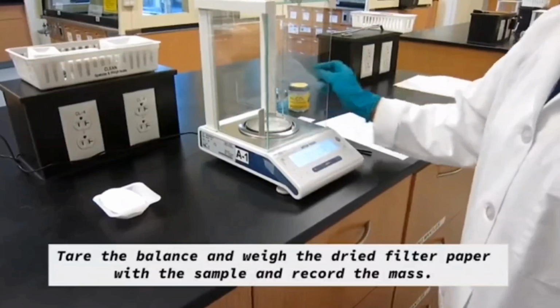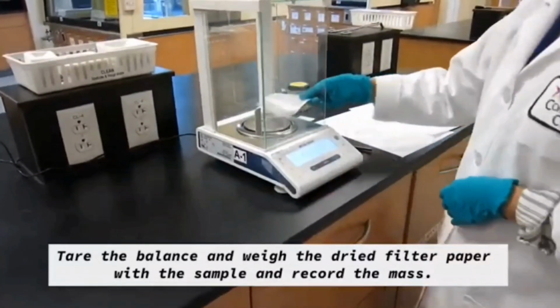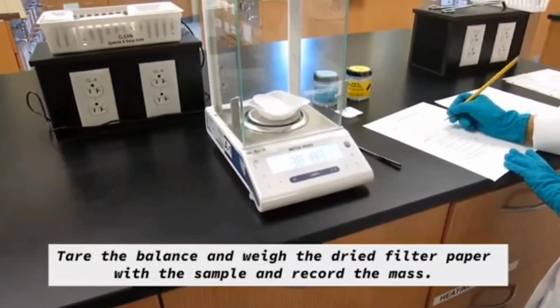Now our calcium carbonate precipitate is ready. You're going to take it to the balance, zero the balance, and weigh the dried filter paper and the weigh board. And you're going to record the mass.